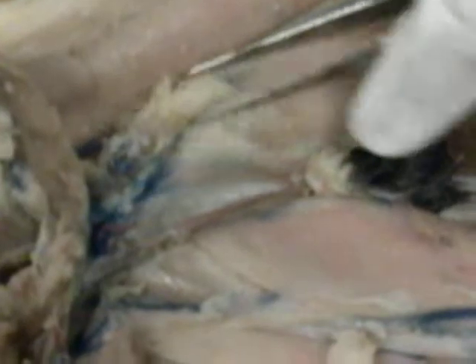Where's the other one? I don't know, I've only found one. Yes. You have to have 2. Yeah. It's a little deeper than the other ones were. Okay, I want to take off that. I'll leave that artery ring on there. Okay. So the other one's right here. So 2 spermatic cords. You can also take off a little bit like that. So one here and one here.